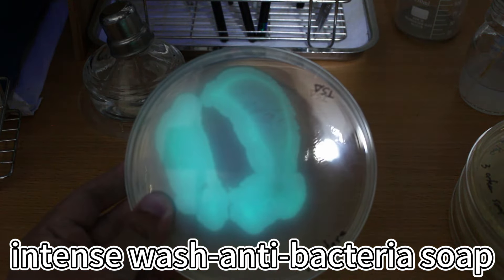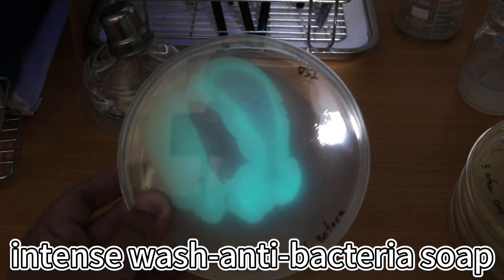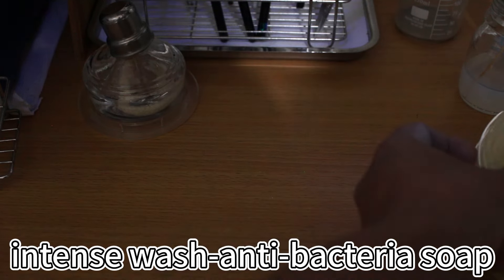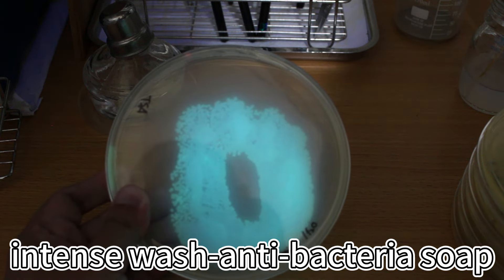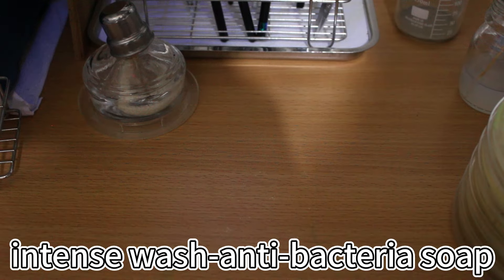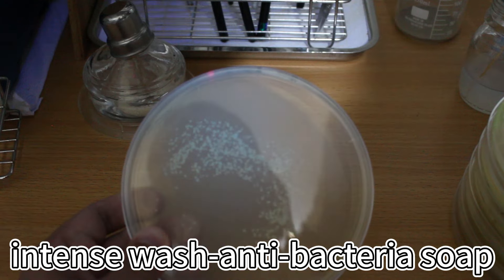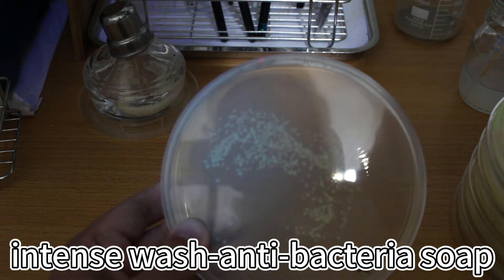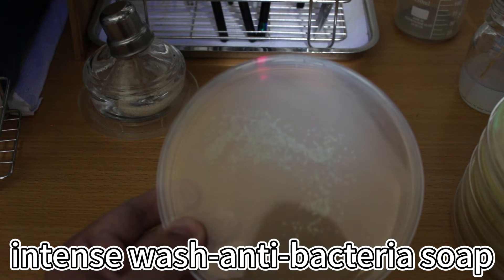And now is the before wash. This is the antibacterial soap group. After water rinsing. And last is after intense wash with antibacterial soap. You can see there is almost no glowing colony. I think there is no visible glowing colony.